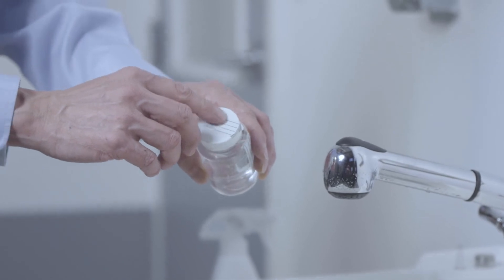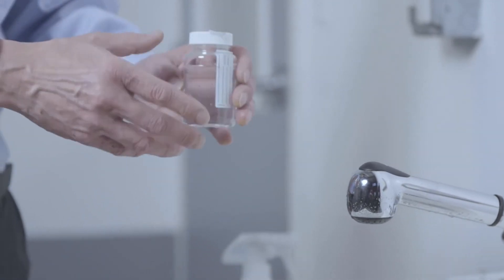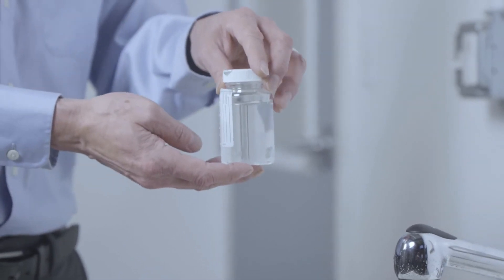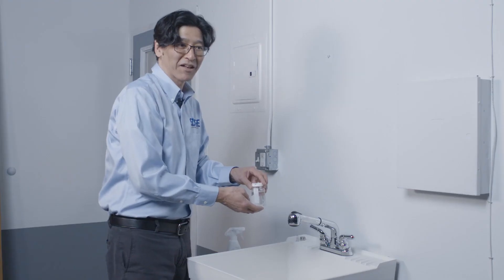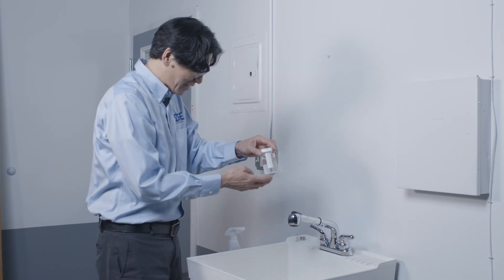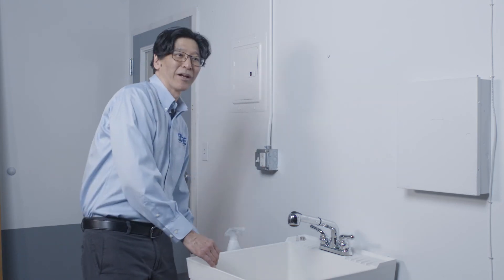Now you're just going to want to fill out your sample information and the paperwork that you have and deliver this to the laboratory. This test has to be performed within 30 hours of sampling. So it's important that you deliver it to the lab within 24 hours. So it's time to get this guy in a cooler and bring it on in.